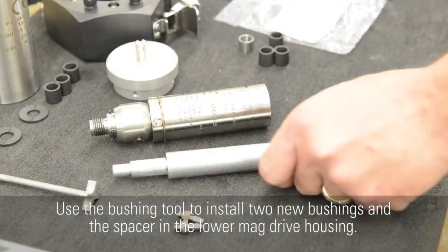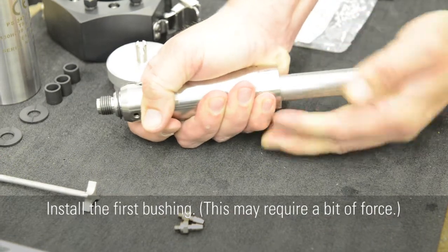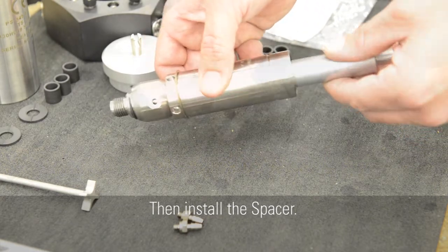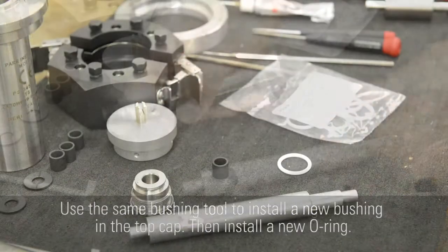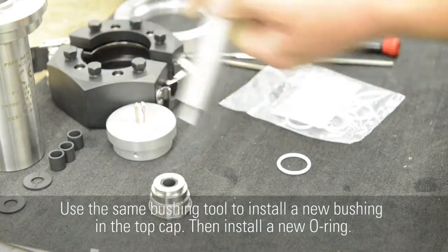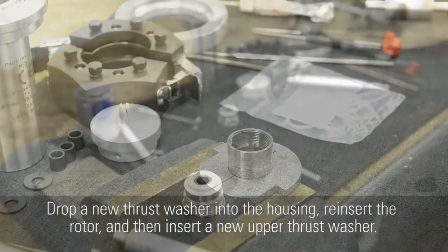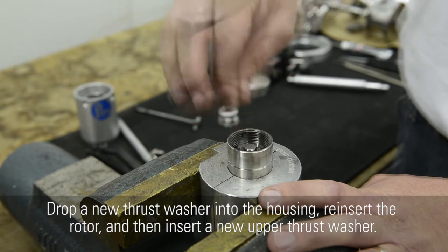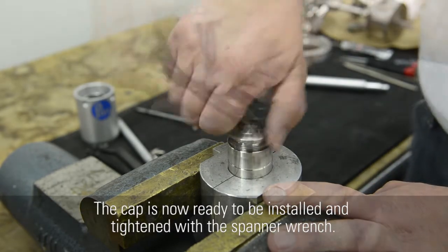Use the bushing tool to install 2 new bushings and the spacer in the lower mag drive housing. Install the first bushing. This may require a bit of force. Then install the spacer. And finally, the second bushing. Use the same bushing tool to install a new bushing in the top cap, then install a new O-ring. Drop a new thrust washer into the housing, reinsert the rotor, and then insert a new upper thrust washer. The cap is now ready to be installed and tightened with the spanner wrench.